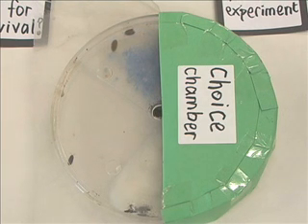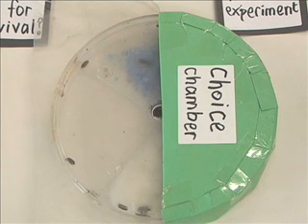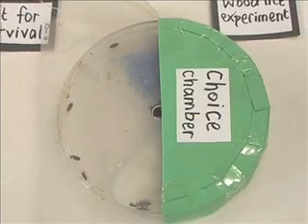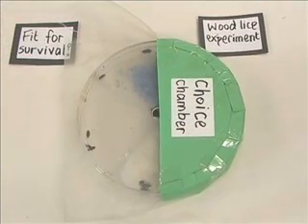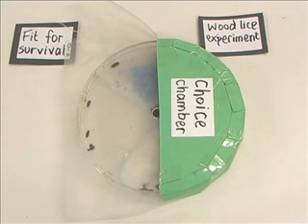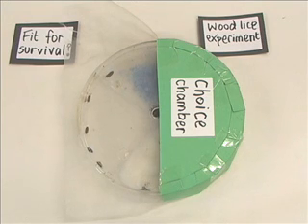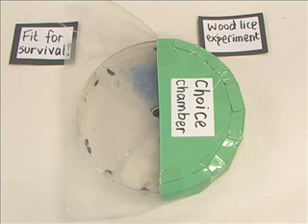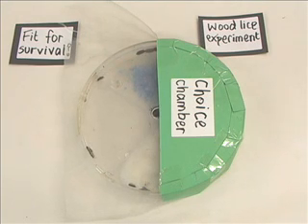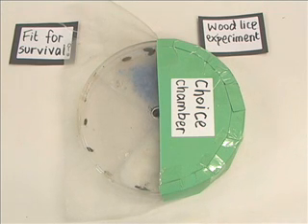Now because you can't see into the dark side, it helps if you know your total number of woodlice — because then you can work out how many are hiding by counting how many you can see and taking that away from the total. Using the choice chamber, we usually find that woodlice like damp and they like dark — exactly the conditions that they find in leaf litter. Those are the conditions that they are perfectly adapted for.